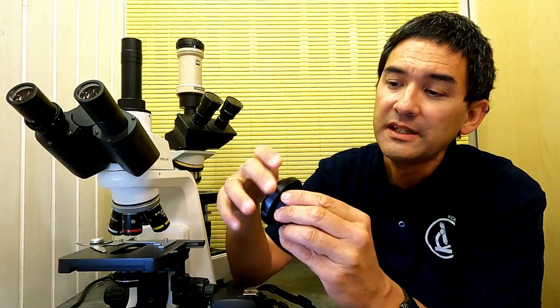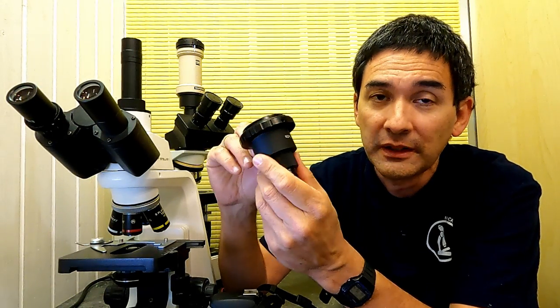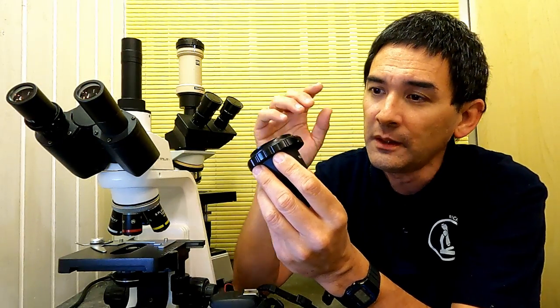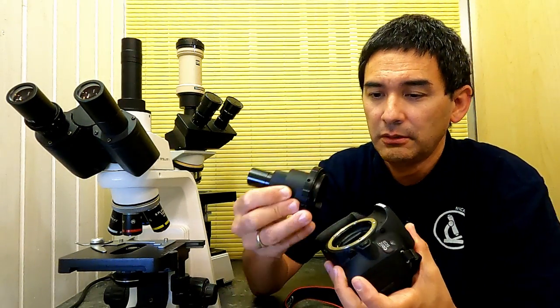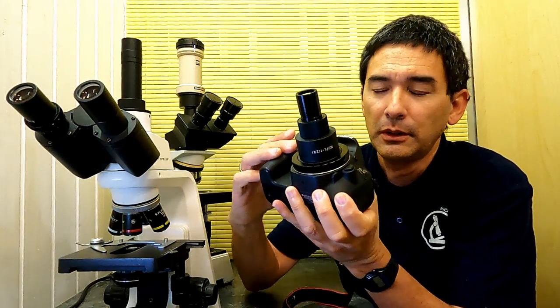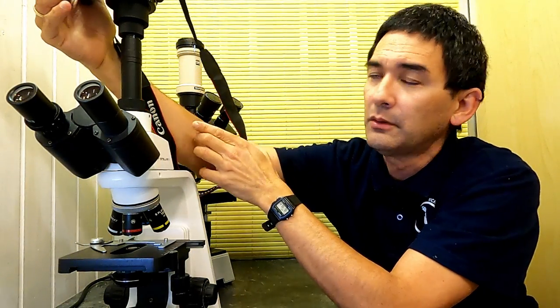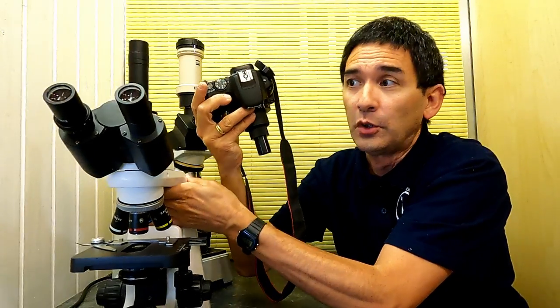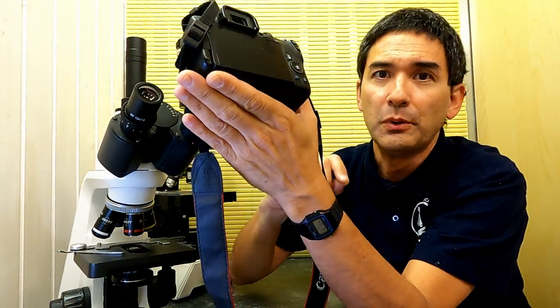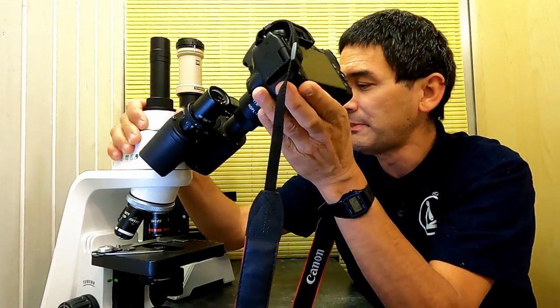And it works like this: there is an adapter ring which is camera specific, and so for Nikon and for Canon, there are plenty of those available. If you have a mirrorless camera, you also have to get, of course, one for a mirrorless camera. And then what you do is the following: you simply remove the lens, and then you connect the adapter like this, and there's optics in here, and then it goes all the way to the top of the microscope, and you can start taking pictures and videos and so on. And if you do not have a photo tube like this, then you can also, if you want to, put it in instead of one of those eyepieces. It's also possible, not always very stable, especially if you've got a smaller microscope, from the balance perspective, but you know, you get the idea.